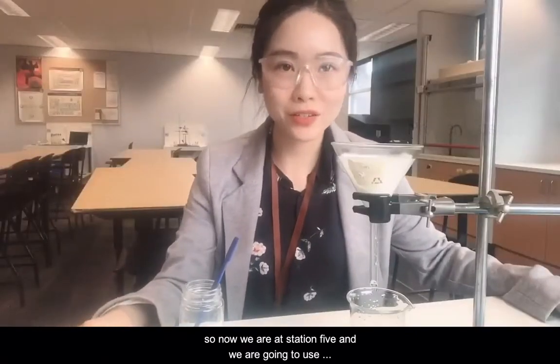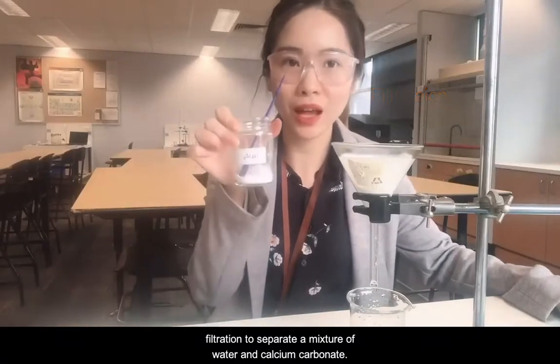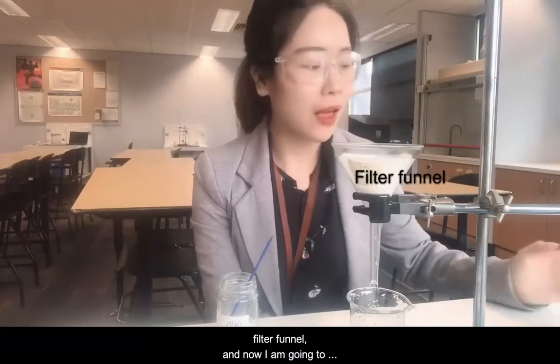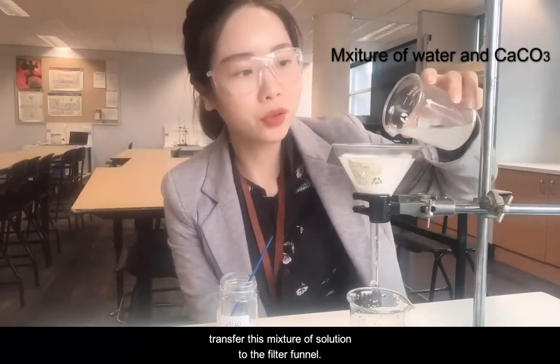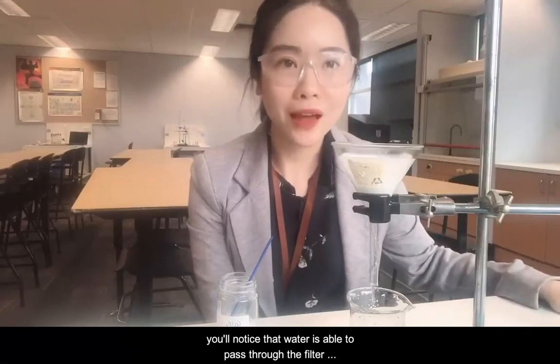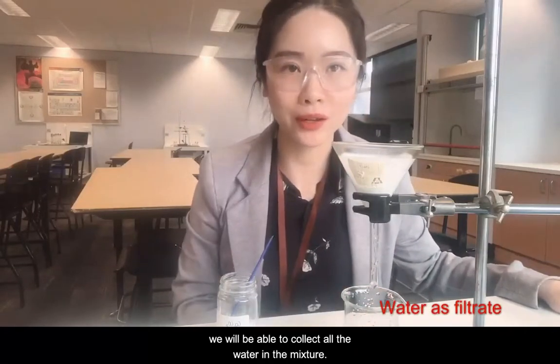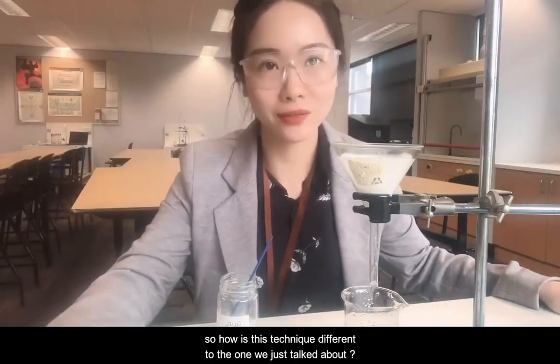So now we're at station 5 and we're going to use filtration to separate a mixture of water and calcium carbonate. What you see here is folded filter paper that fits on top of the filter funnel. And now I'm going to transfer this mixture solution to the filter funnel. You'll notice that water is able to pass through the filter paper and the filter funnel. And in the end, we'll be able to collect all the water in the mixture. So how is this technique different to the one we just talked about?